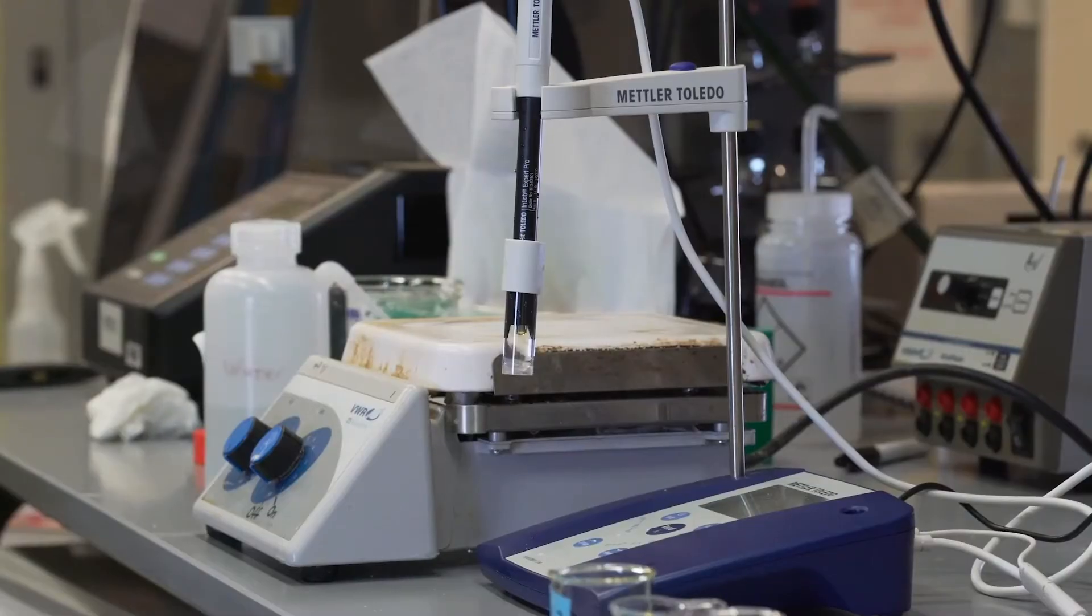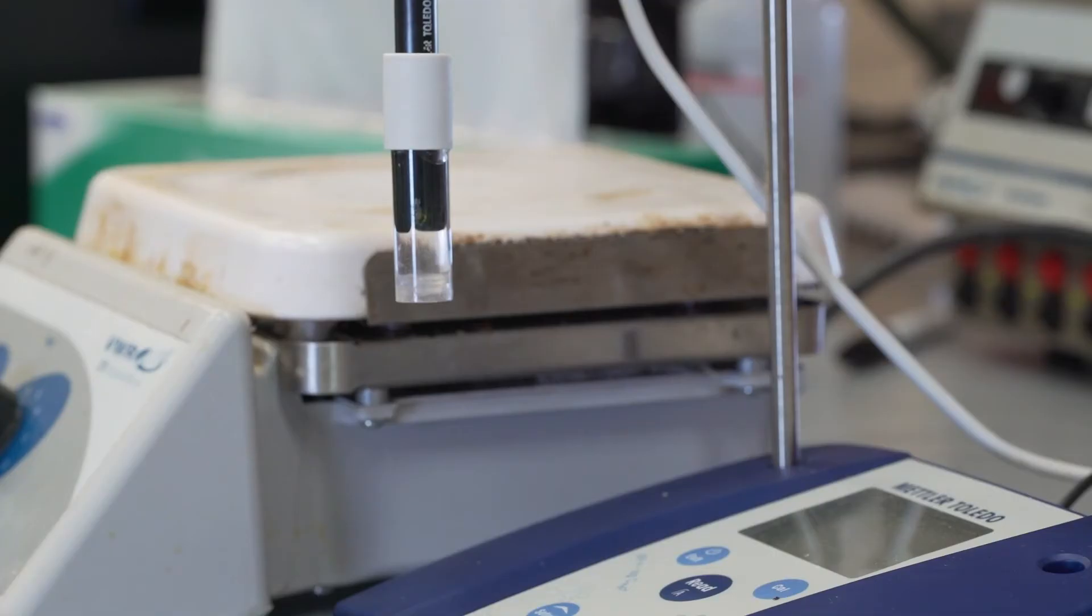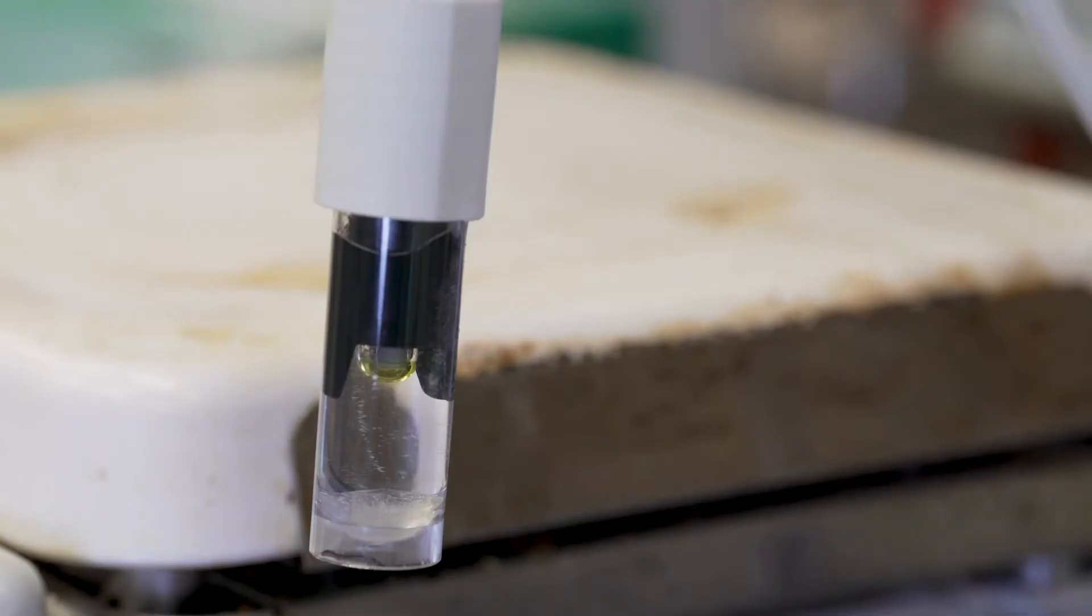The electrode needs to be stored in a potassium chloride buffer and should never be allowed to dry out. She needs to stay moisturized to live her best life, don't we all?